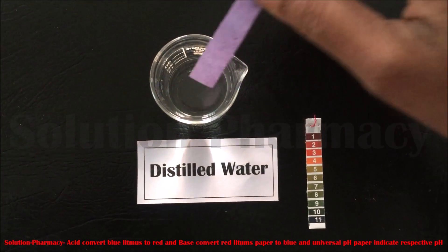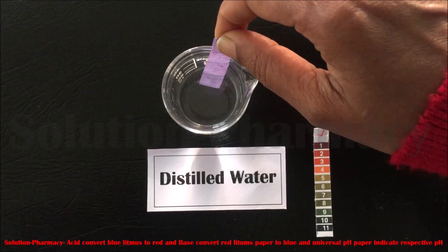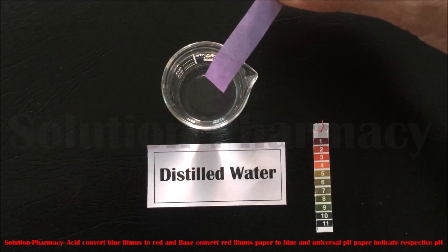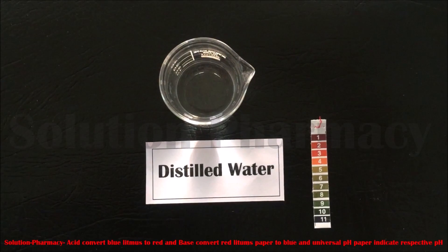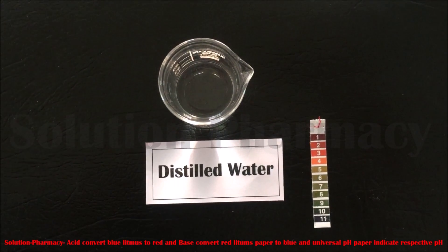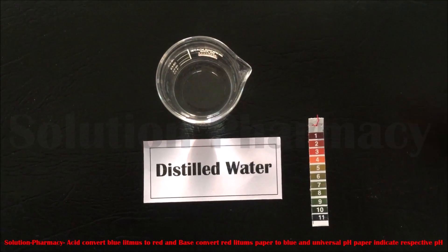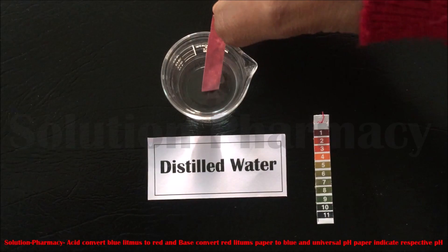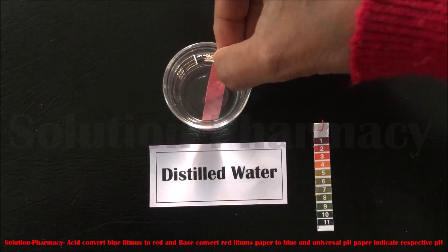Here we have taken distilled water in a beaker and dipped a blue litmus paper into it. After a few seconds, remove the blue litmus paper and observe the color change. You can see there is no color change in the blue litmus paper. If blue litmus paper changes to red it means the solution is acidic in nature, and if red litmus paper changes to blue it means the solution is basic in nature.